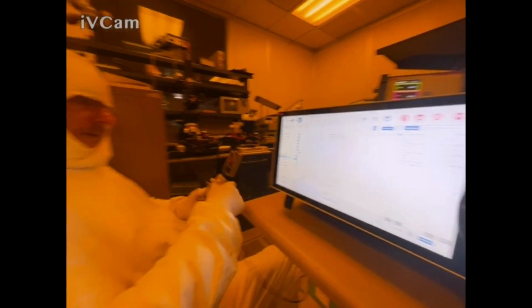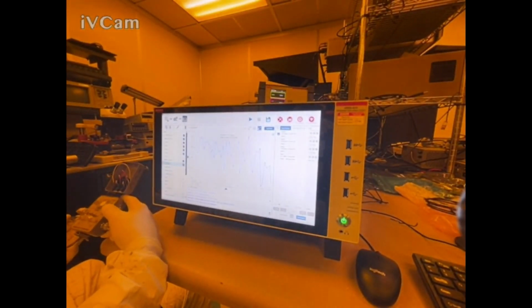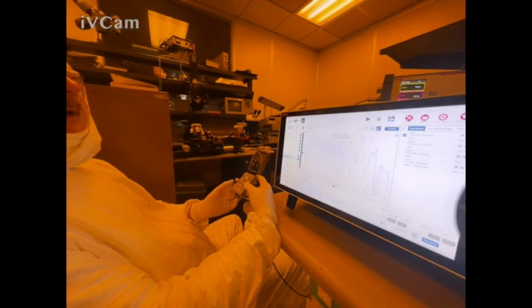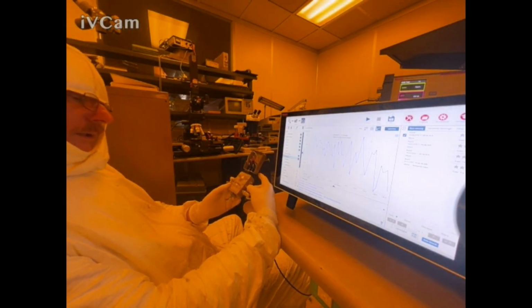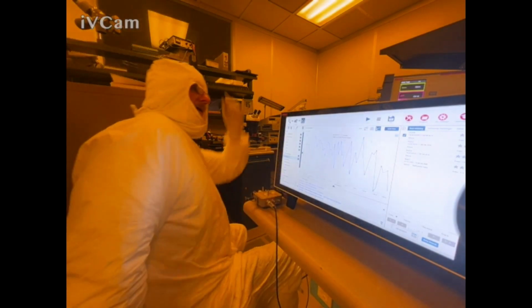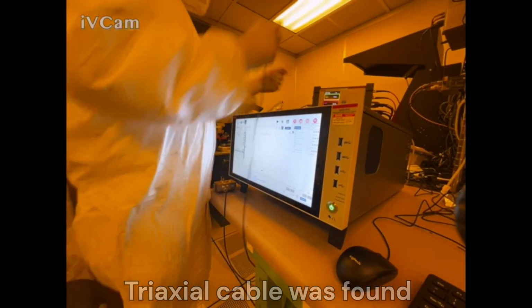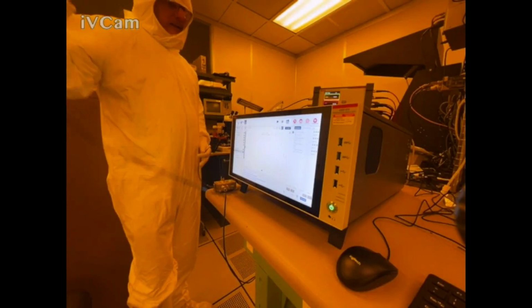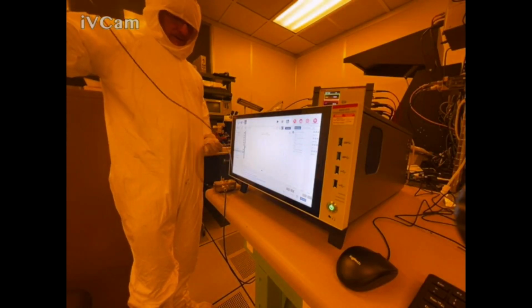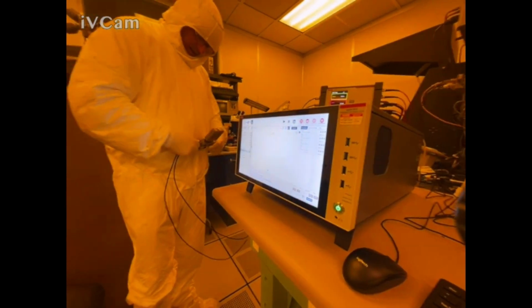Let's see. And are these connected right? One is the source. Two is the drain. Three is the gate. And four is open. Give me another cable. Do we have to do the compensation again? Yes, if we are adding a new cable. No, we shouldn't. Even if you're adding a new cable? Let me see. Yeah, we will. We'll do it.